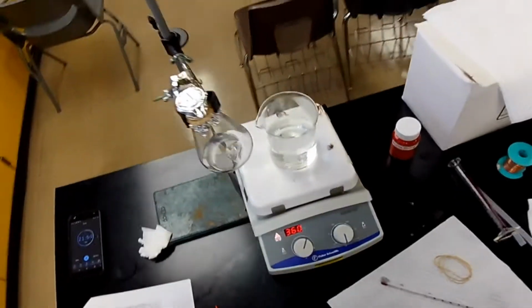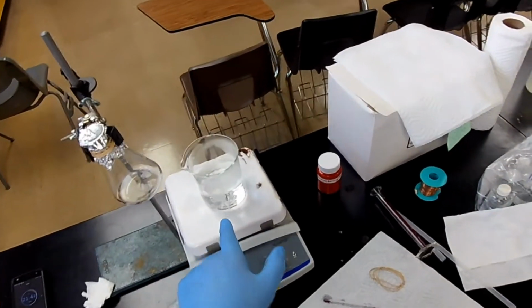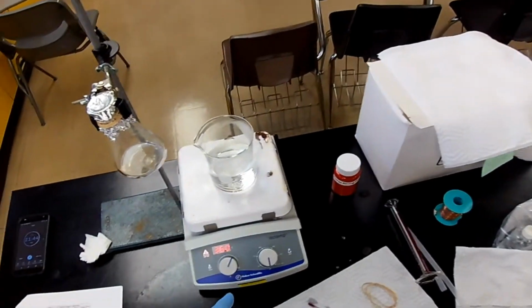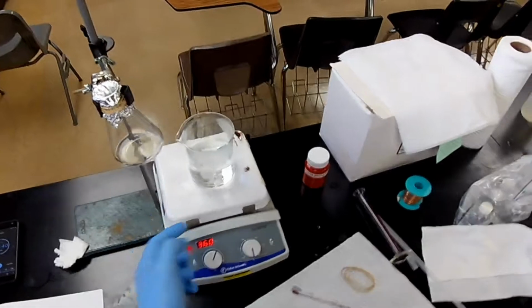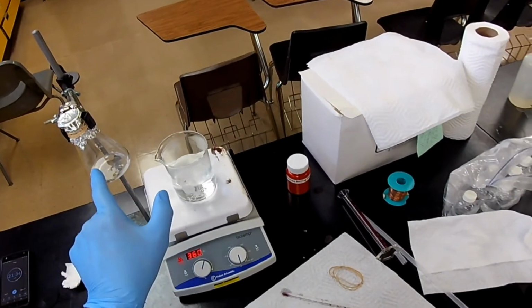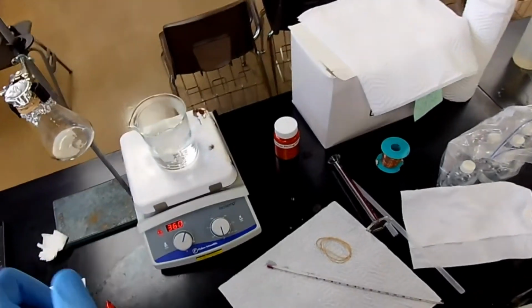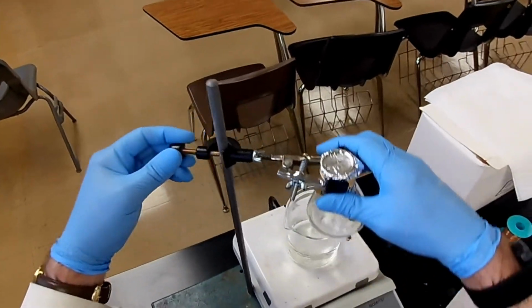Okay, now what's going to happen when we put this flask in there? It's going to absorb heat from the water and probably stop it from boiling, right? So, right when we take it out, we remeasure the temperature. That's the temperature that corresponds to the gas inside, not the temperature I just measured. That was just my curiosity.